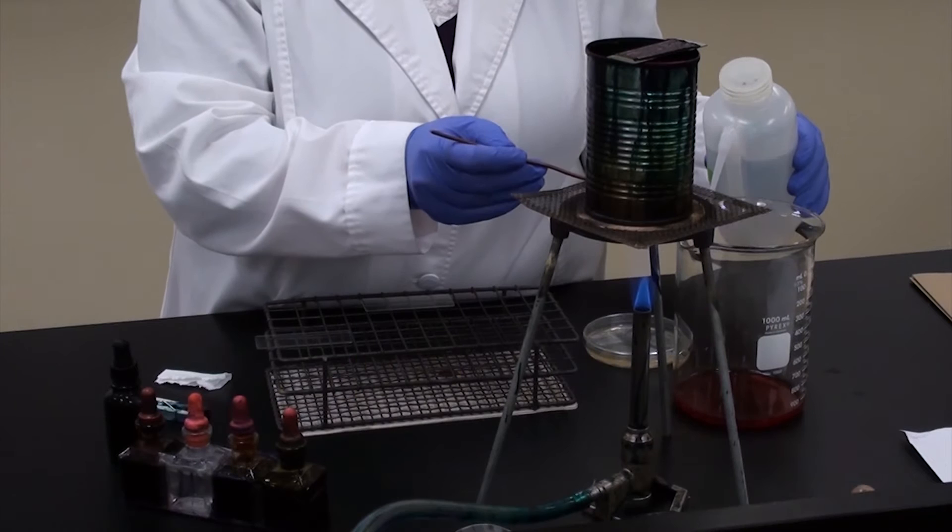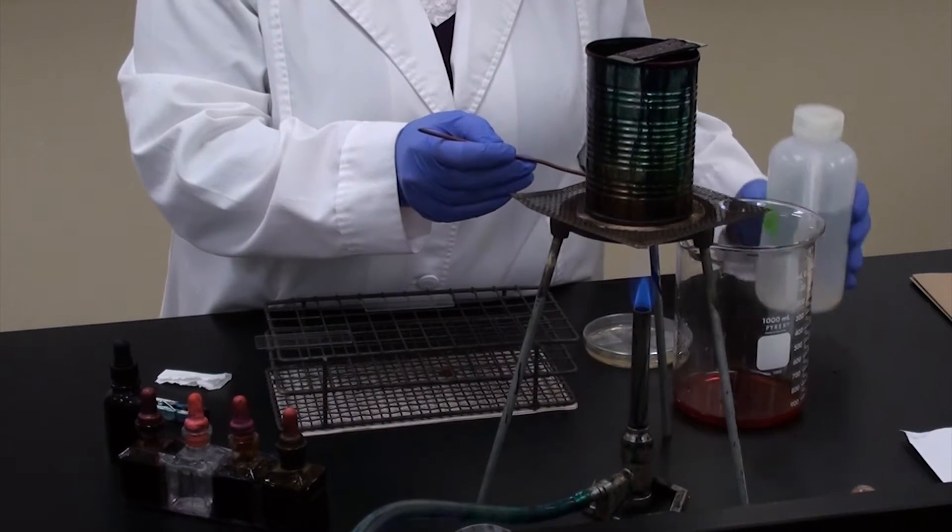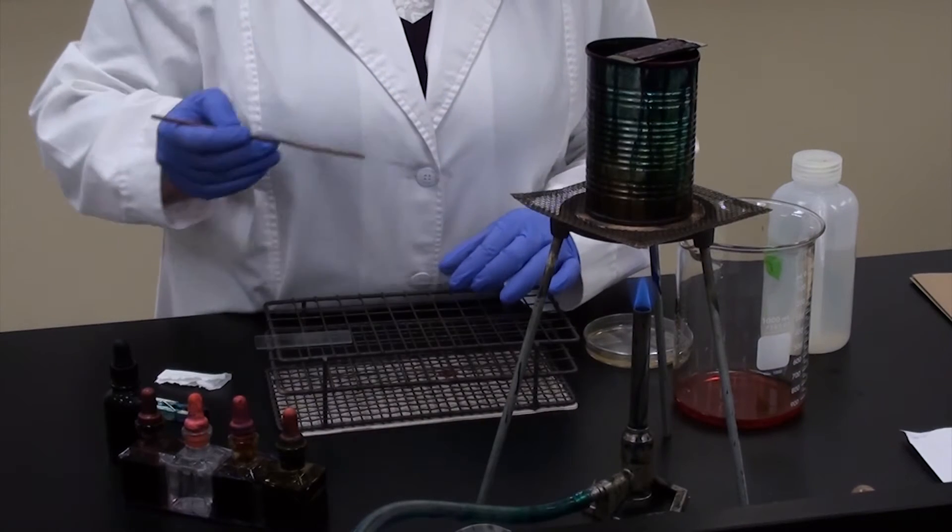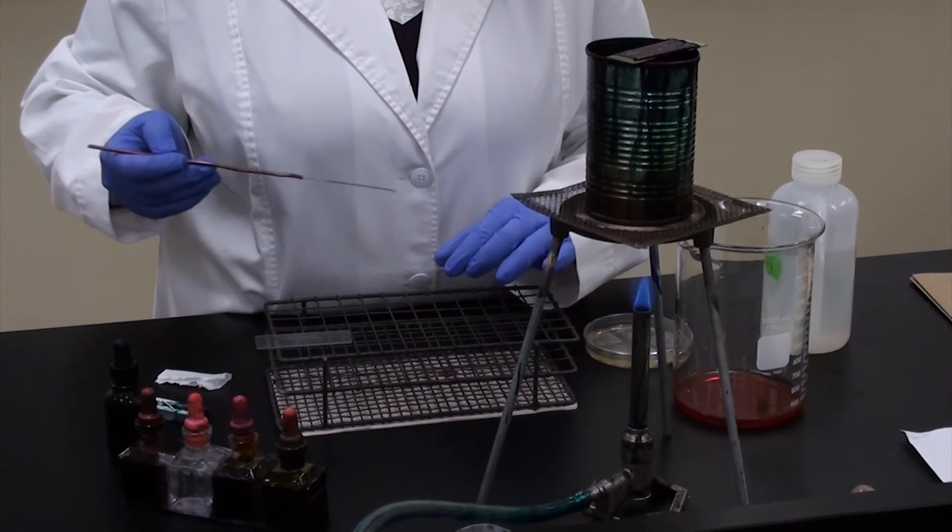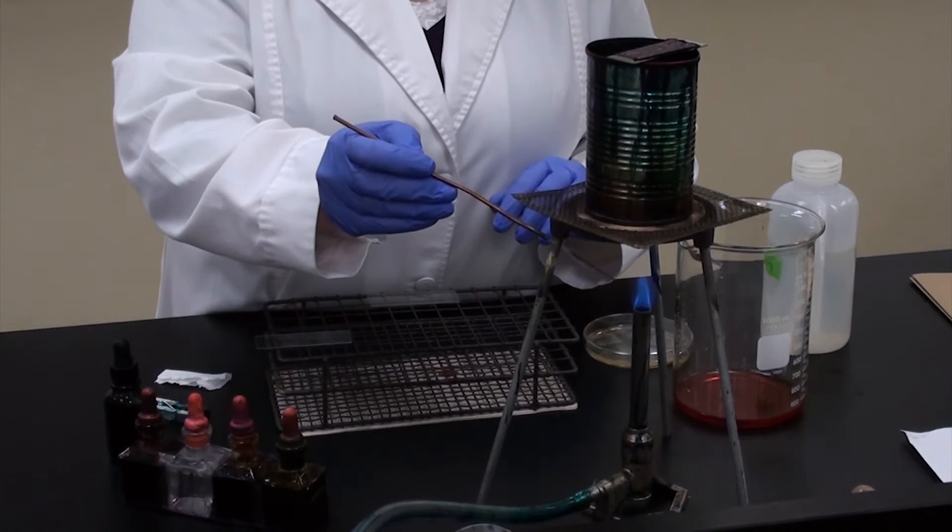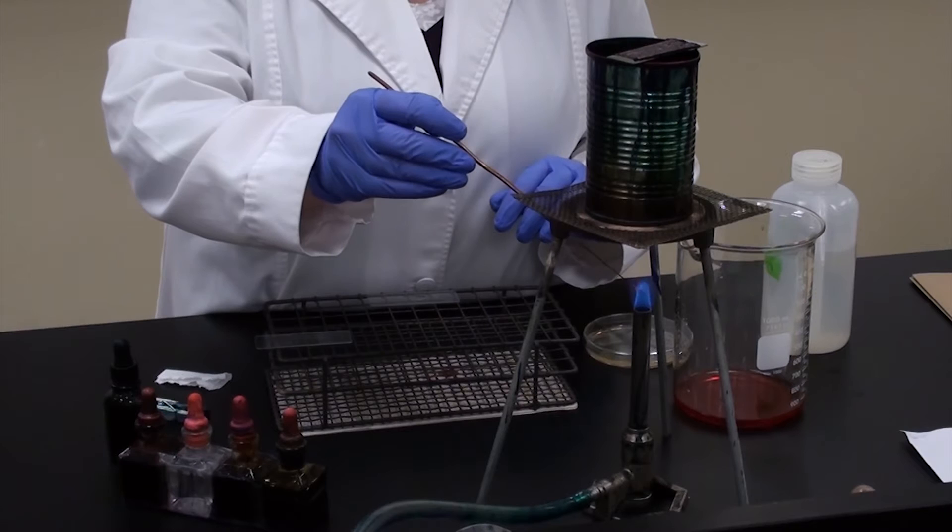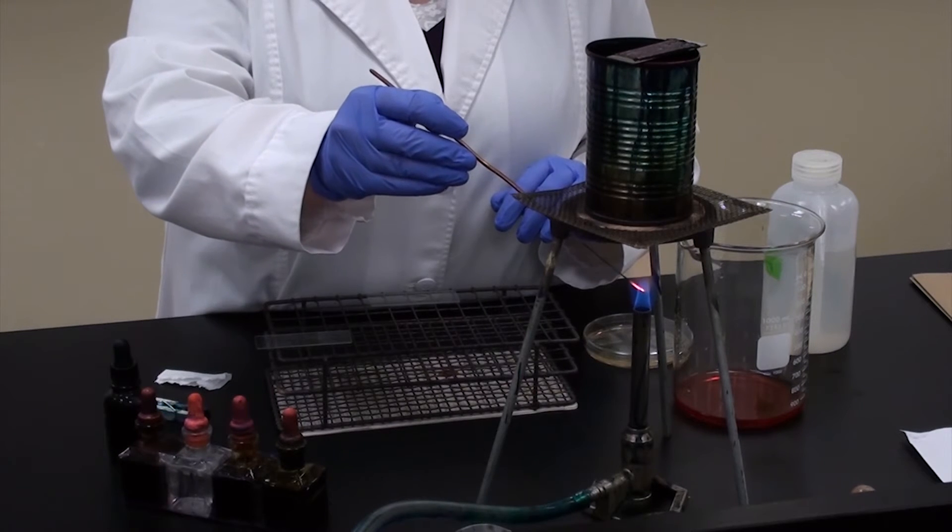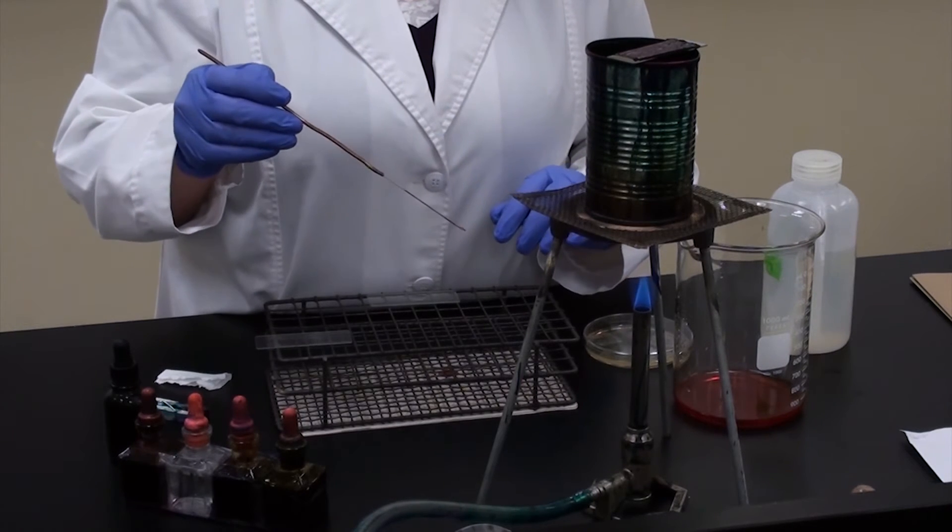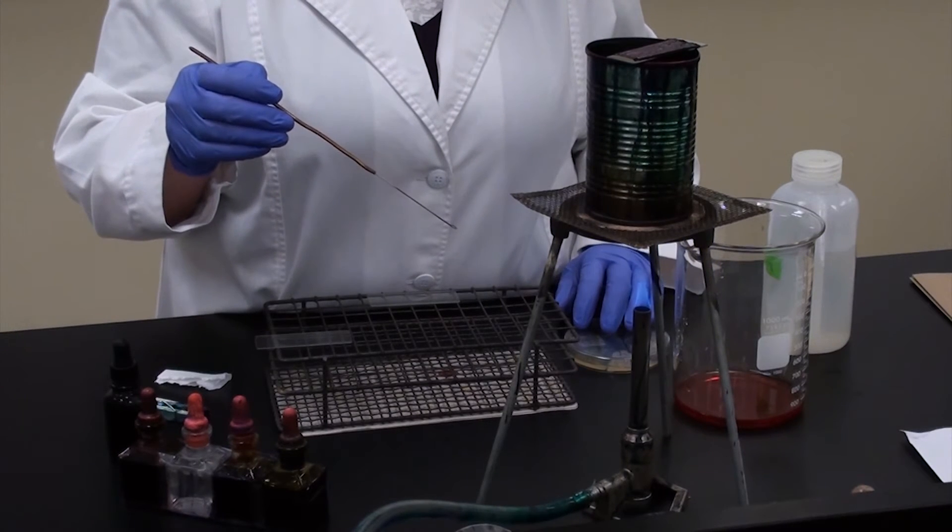Transferring a small drop of water to the slide, reflaming the loop, always aseptically transfer, and letting it cool completely before we try and transfer over our bacteria.